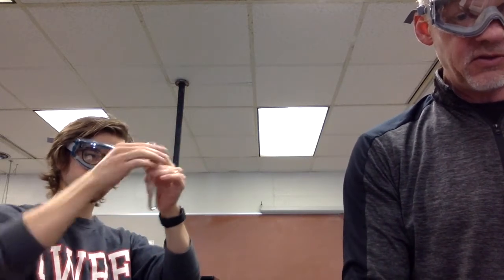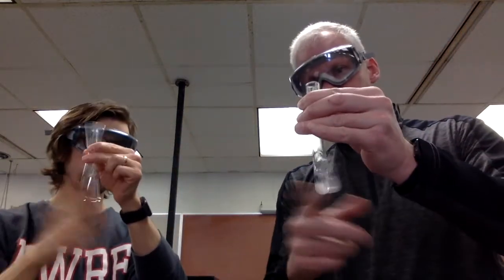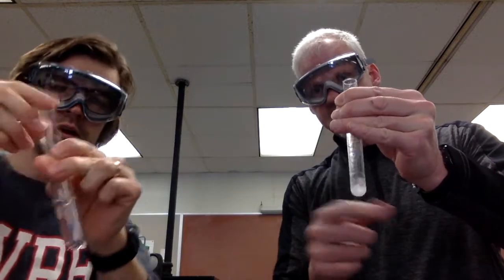So let's do the MTBE while this one waits. I've got methyl tert-butyl ether, a common organic solvent. I'll put a couple squirts of that into the test tube with the sodium chloride. And then I will mix that a similar way. And you can see that the sodium chloride is now fully dissolved in the water. You can't see any pieces of it left. We call that soluble.